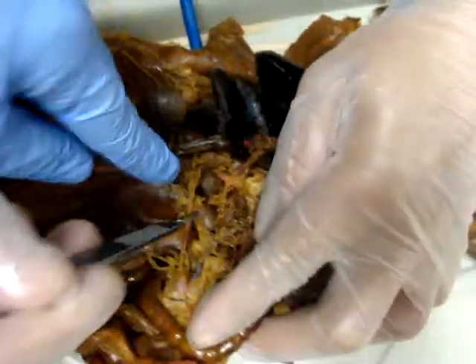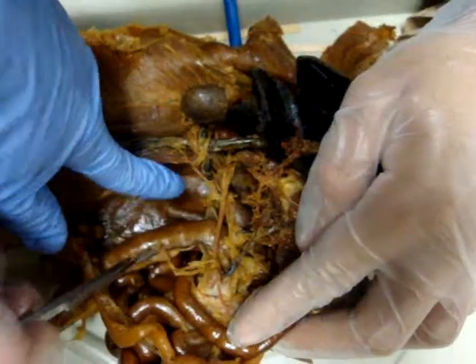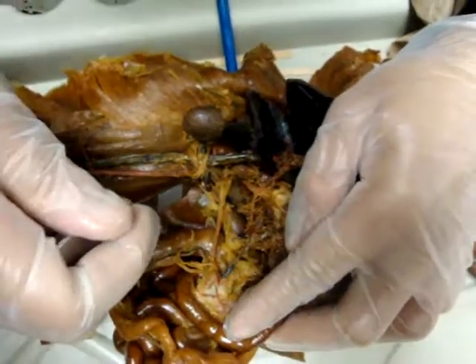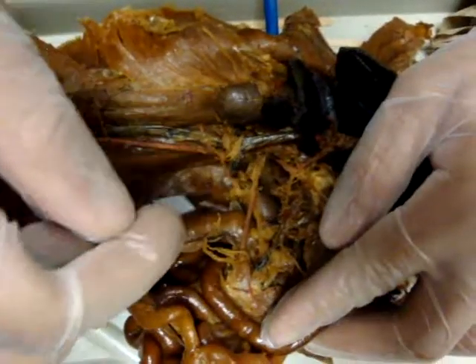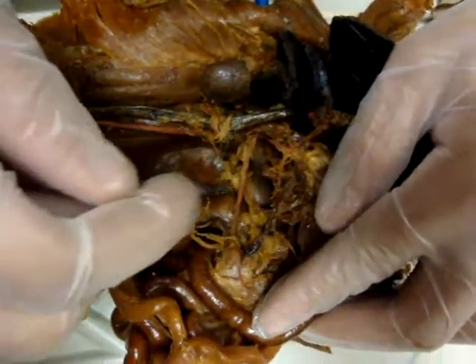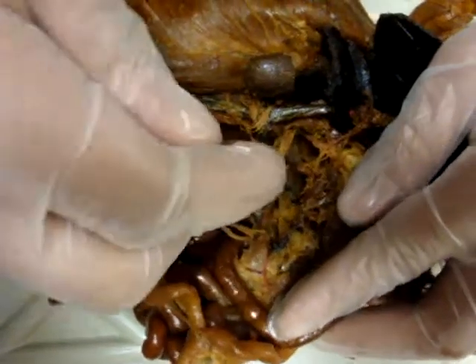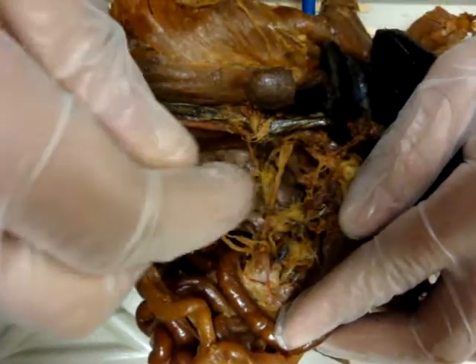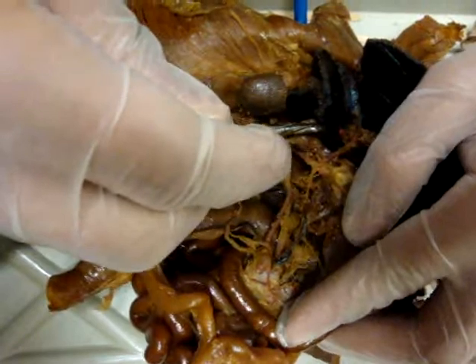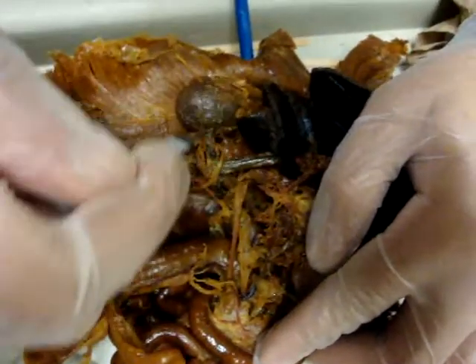This is the kidney? This one is the superior mesenteric? I mean the inferior. No, this one — this is the renal artery. It's going to the kidney, right there. Nice little kidney.